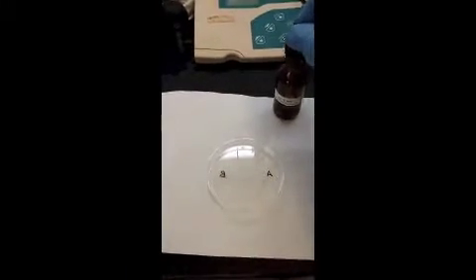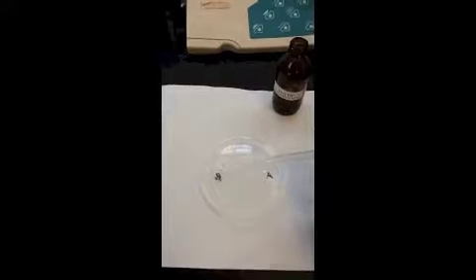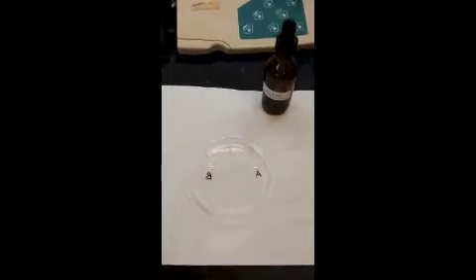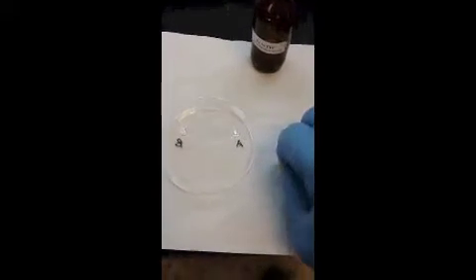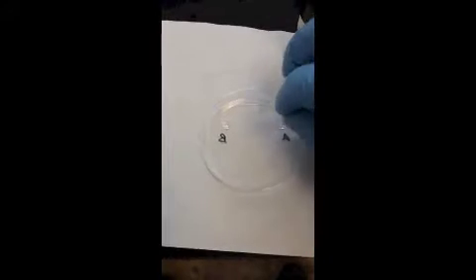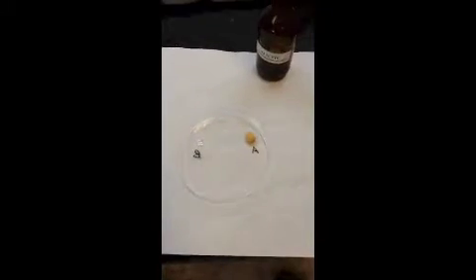Okay, so here's our petri dish, and I'm going to get a little bit of our dye. I'll put a drop into each of those two locations. Okay, I'm now going to take my embryos. So I have, oh, dropped it. So I have this seed. This is a chickpea that's been split open. I'm going to take that and just put it face down into one of the drops. Okay. I'm going to take the other seed and put it face down into the second drop.